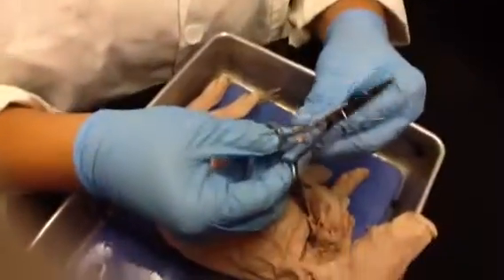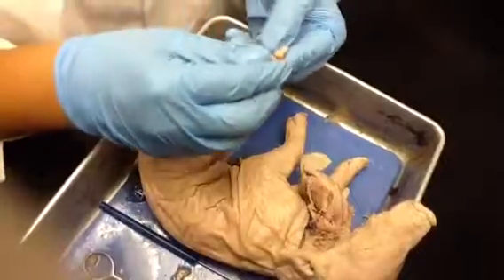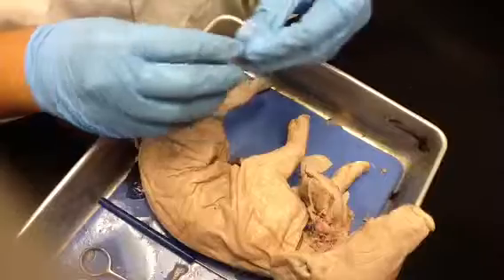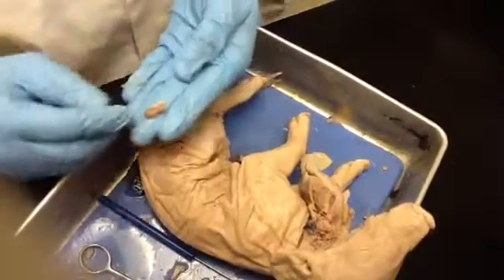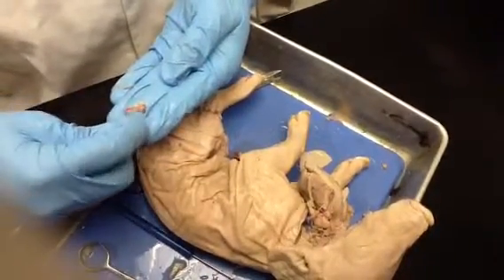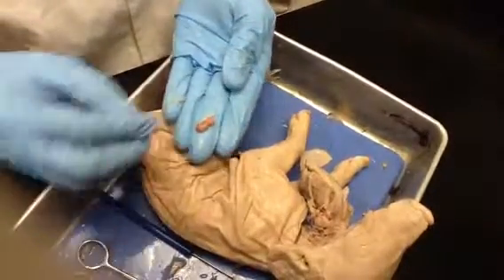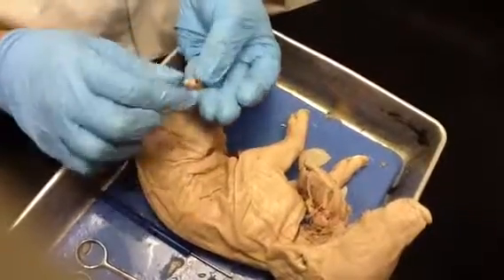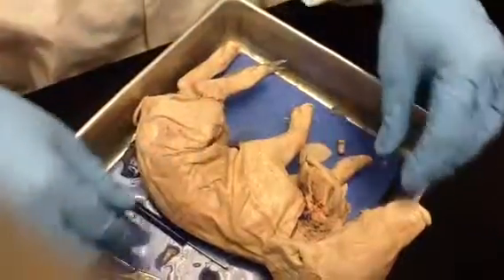So that's actually two of his teeth. Obviously the teeth had not emerged yet, and I didn't get all of the root. Sorry about that. This would be the crown, the white part. The root, or part of the root, is that reddish part. And then the rest of the root would be down here, the actual mushy part of the root, which of course I couldn't get because that broke. That's the enamel, basically, the white part.